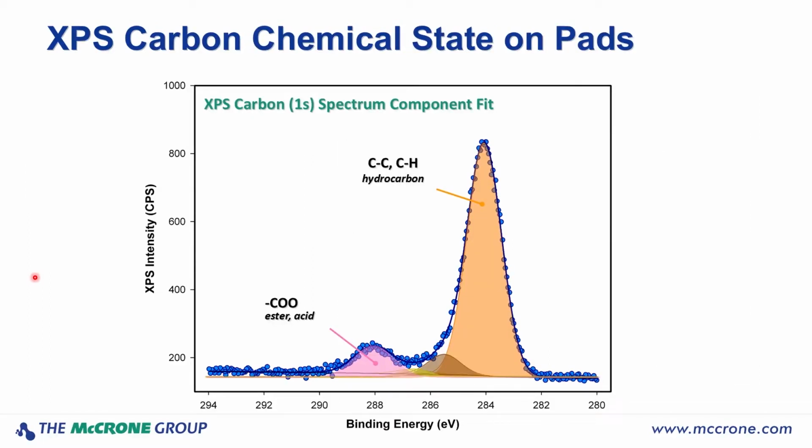So if we look at the carbon photoelectron peak from the contaminant we identified on the poor aluminum wire bond pads, we can see that the carbon is in a couple different chemical states. The main carbon peak here is from a hydrocarbon type carbon-carbon or carbon-hydrogen bond, but we also have this distinct peak from carbon photoelectrons coming from an ester or acid functional group. So this allows us to say that the contaminant does contain an ester or an acid functionality. It's not going to be as specific as vibrational spectroscopy, where we could maybe identify even more specifically what the material was. But the big advantage is that we are able to do some chemical analysis on these very, very thin layers that would be impossible to analyze with FTIR.